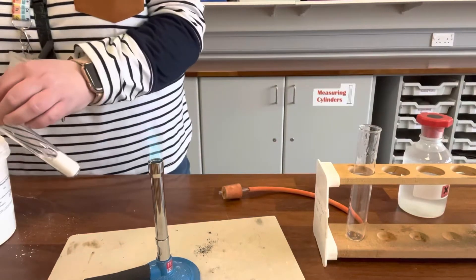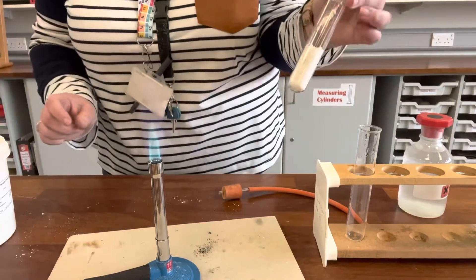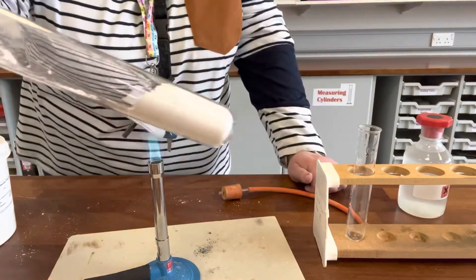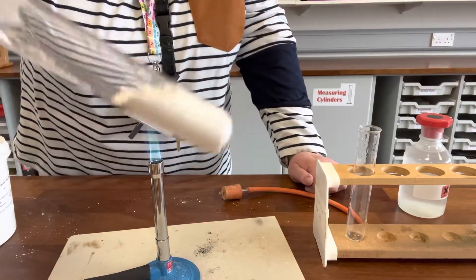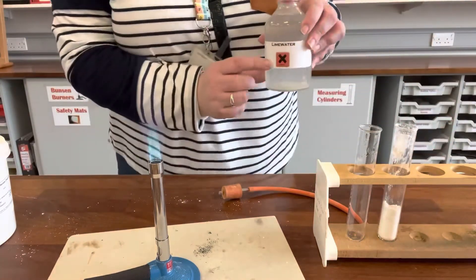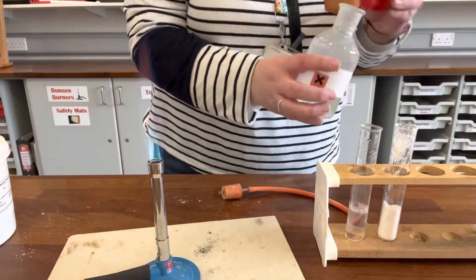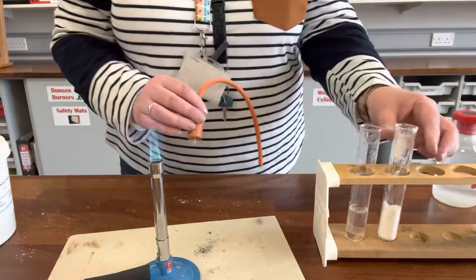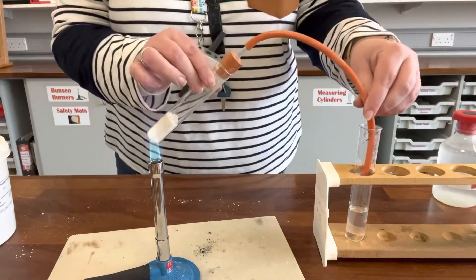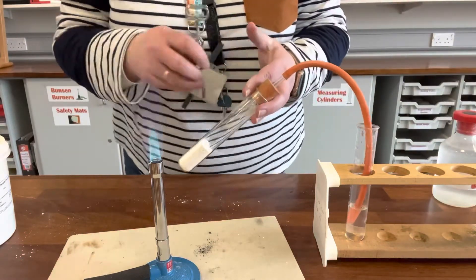In this experiment I'm going to heat some calcium carbonate, which as you can see is a white powder. When it decomposes it breaks down into calcium oxide and carbon dioxide. Calcium oxide is also a white powder, so we won't see a colour change this time. Instead, we're going to use some lime water to prove that carbon dioxide gas is produced. We'll heat the test tube with a stopper and use a delivery tube down into the lime water — when carbon dioxide is produced, the lime water should turn cloudy.